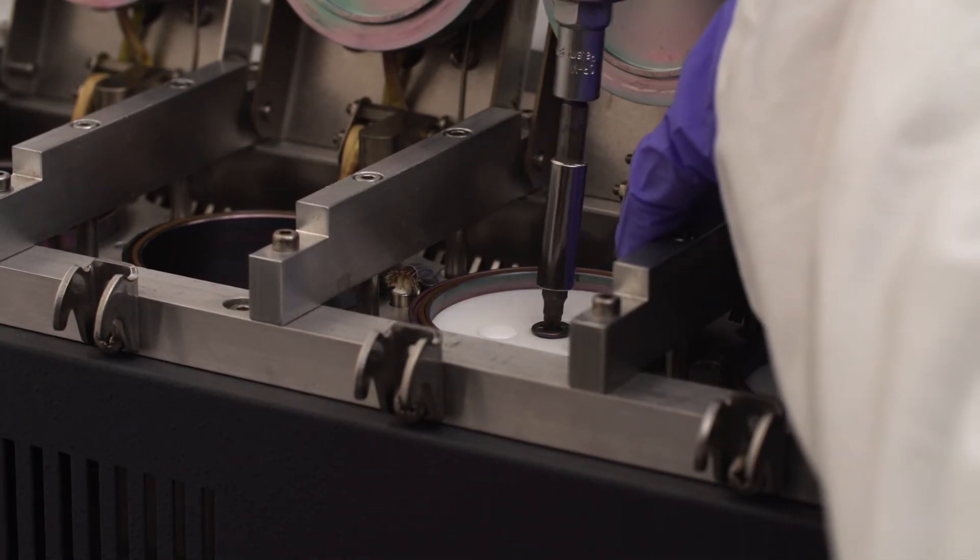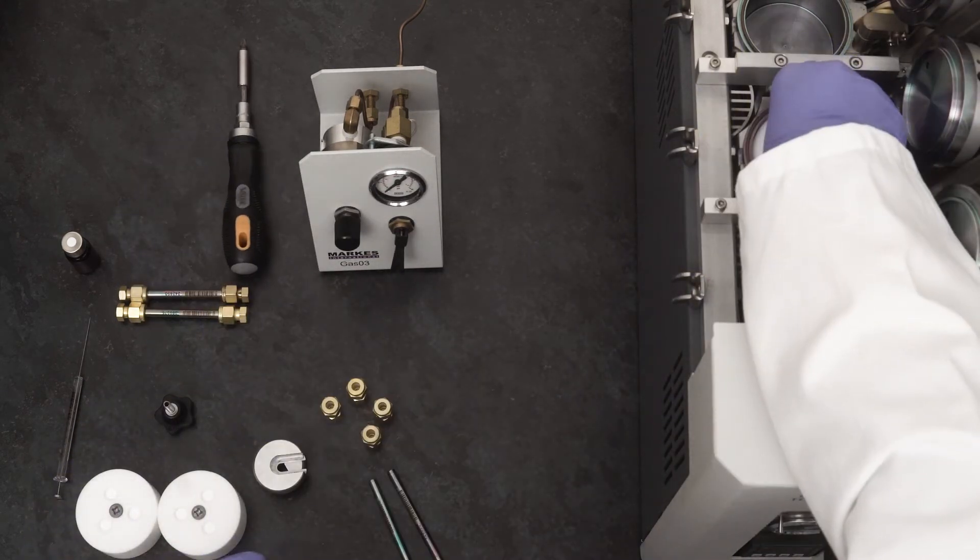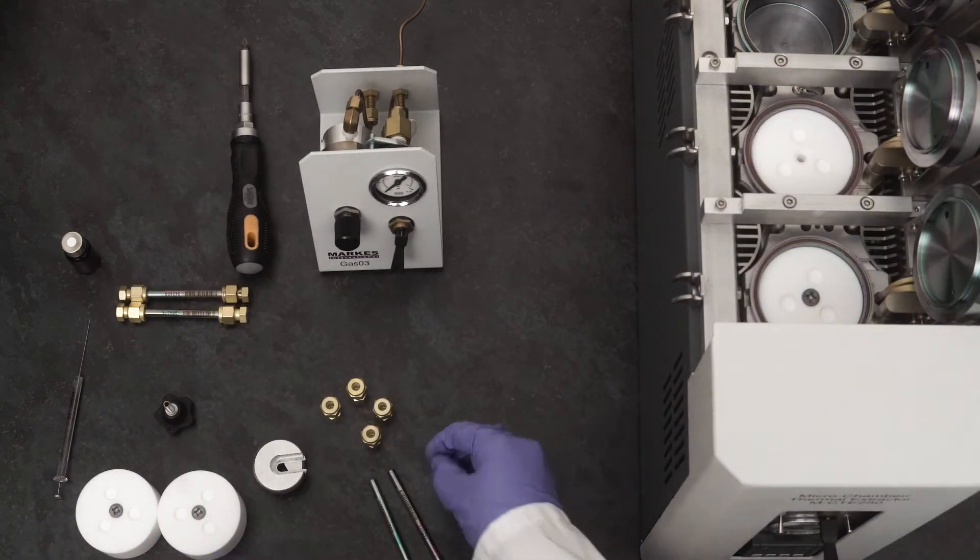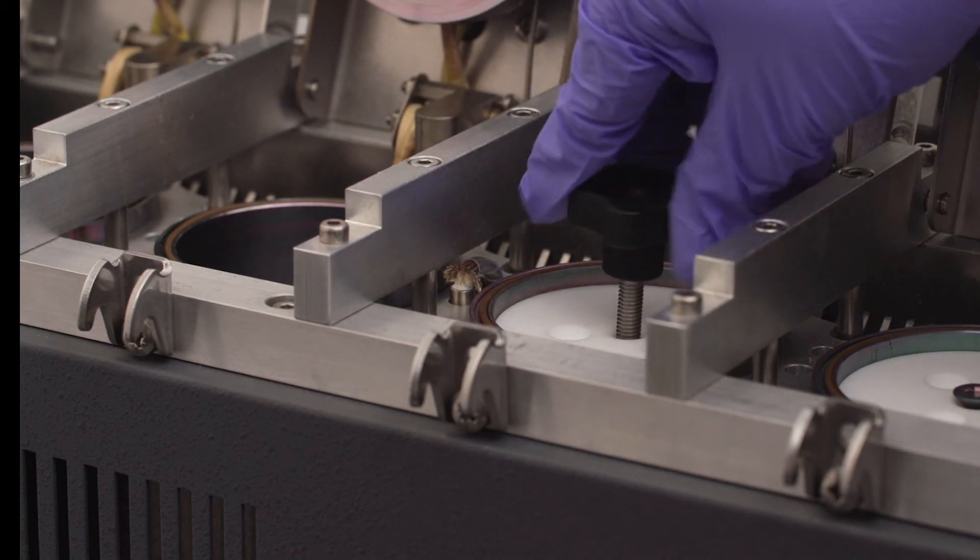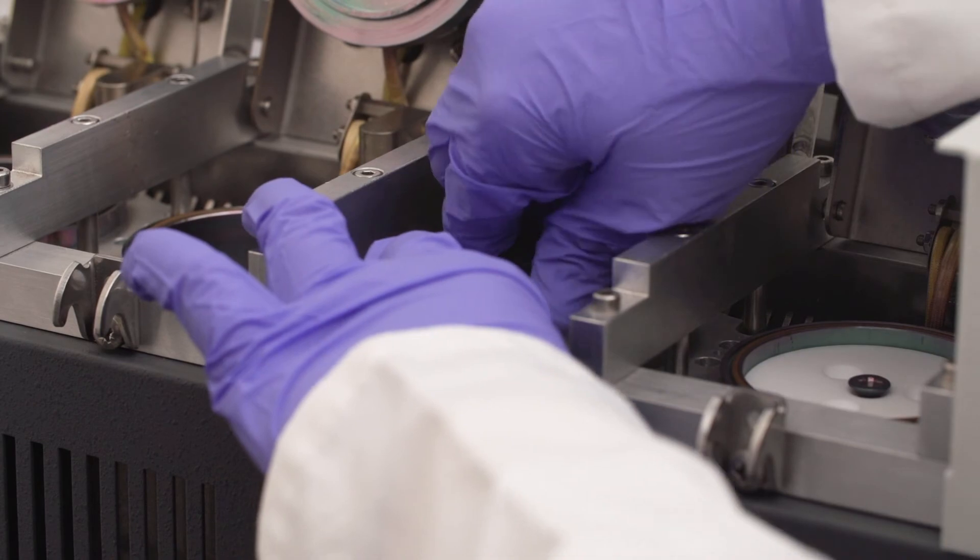Once cooled, remove the blanking screws. Insert the tool lifting handle, gently pull out each block, and clean before storage or reuse.